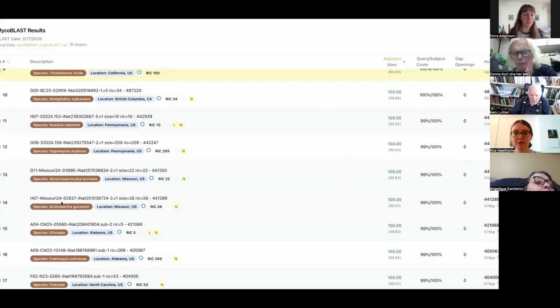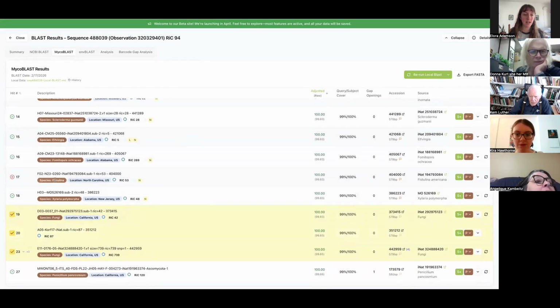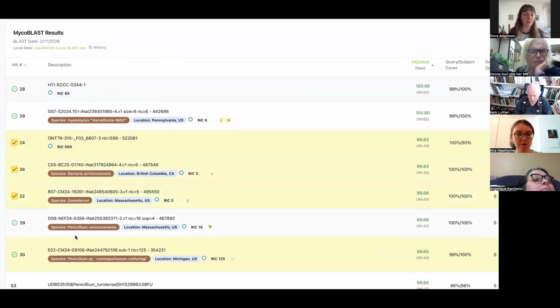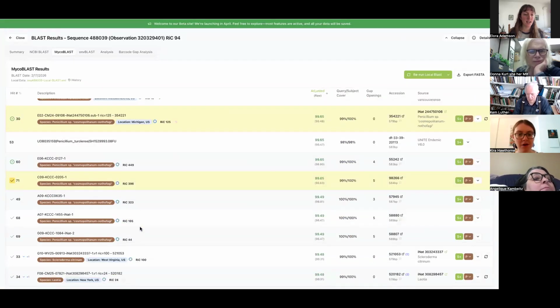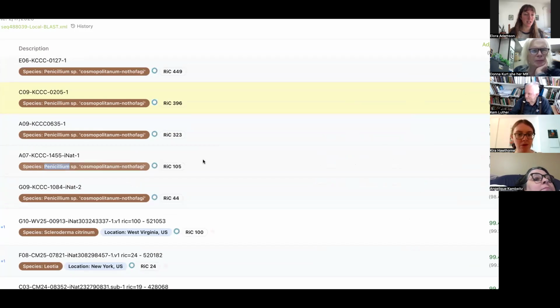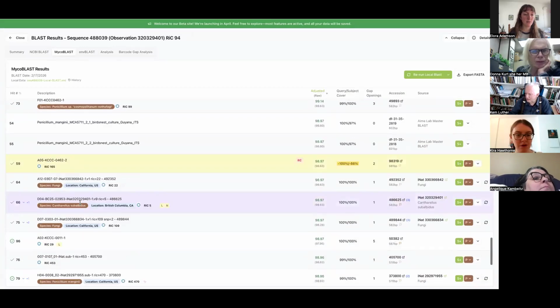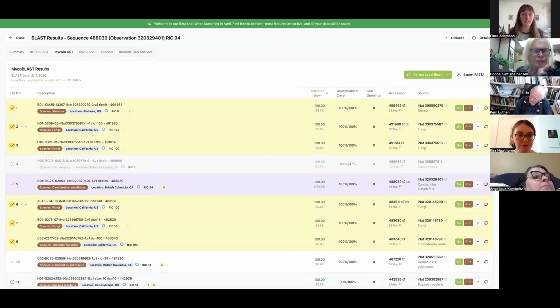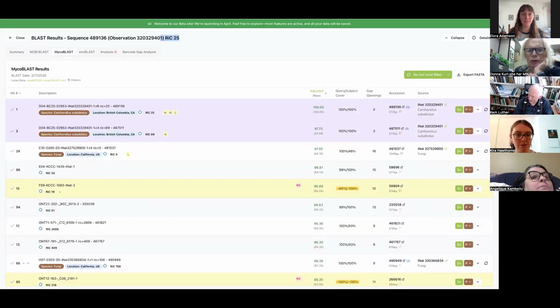That one looks bad. It's a contaminant. We've got good matches, but again, all over the map, no consistency, especially when you start to see things like this. We kind of know we're in contaminant world. In fact, we might actually have something in this genus, but we don't have our chanterelle. So let's leave this for now and make sure 94 reads was marked as non-target.